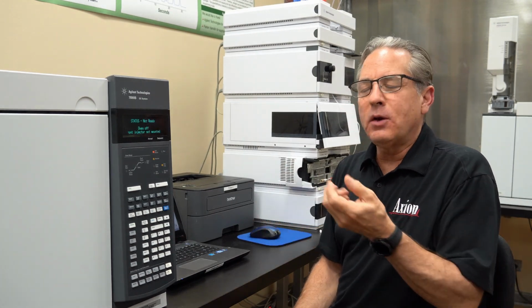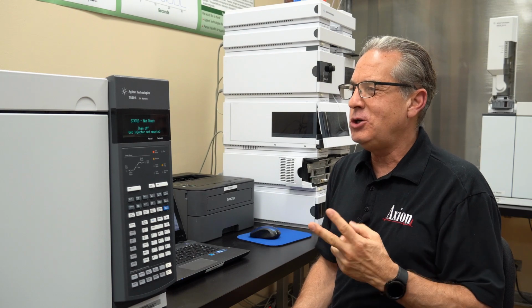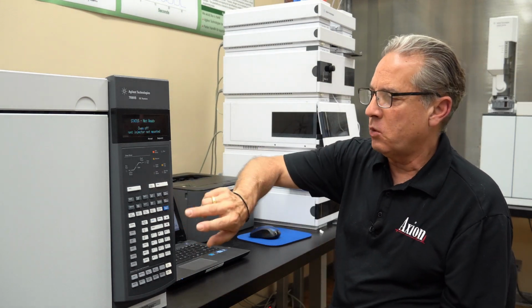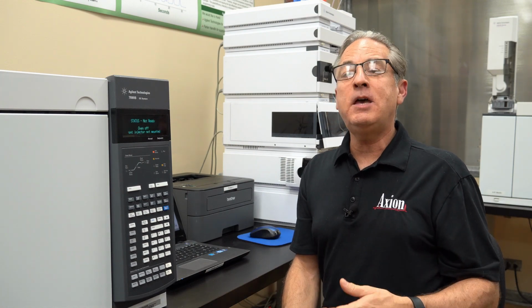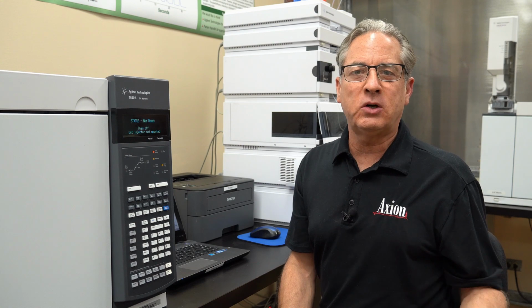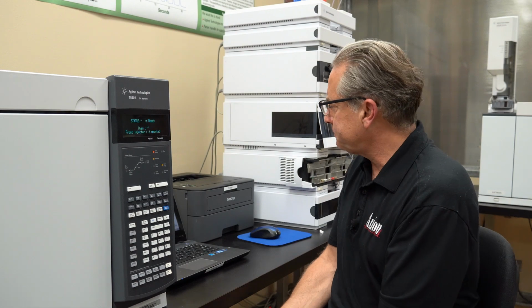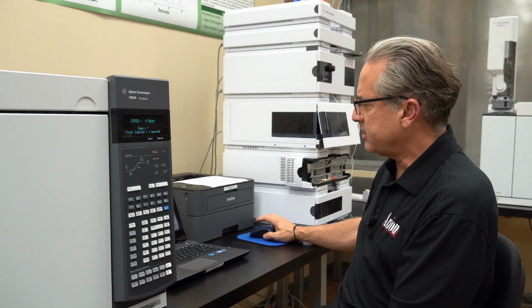So historically or traditionally, the GC has two data paths that can come out, signal 1, signal 2, or now analog 1, analog 2. And these data paths can contain different things. Typically, we think of sending out the detector data out the signal paths. So the front injector and front detector go out of A, and the back detector goes out of B, or 1 and 2. So now let's talk about how we actually assign the test plot.